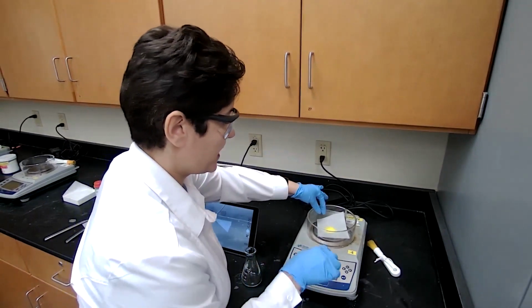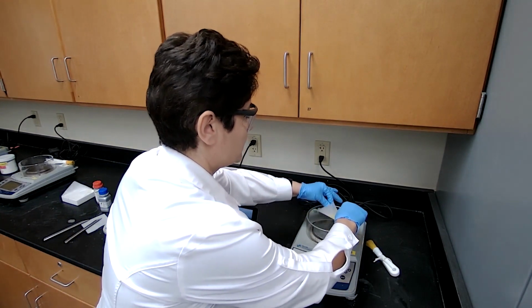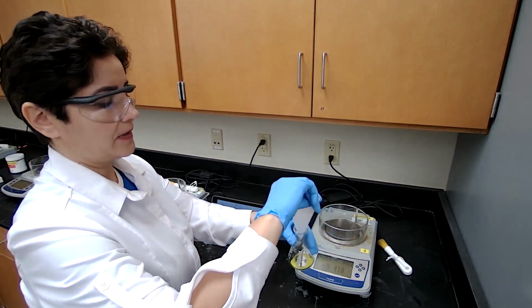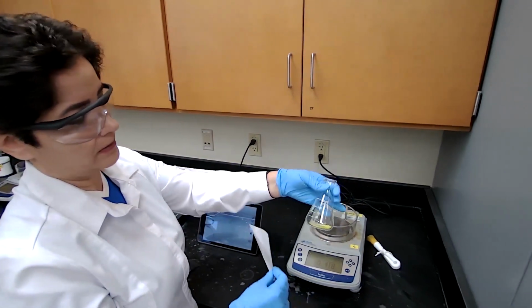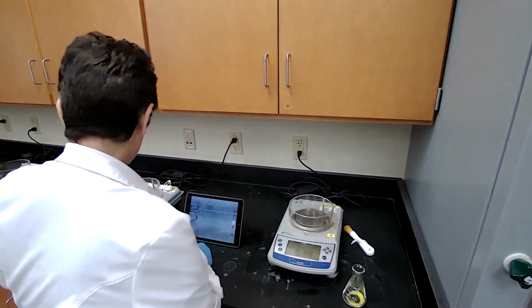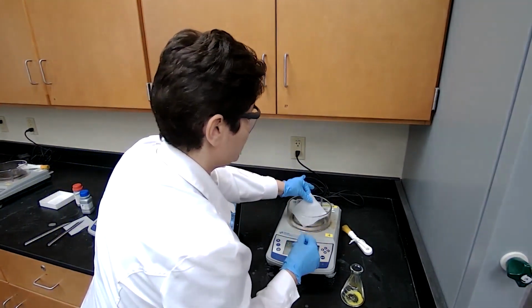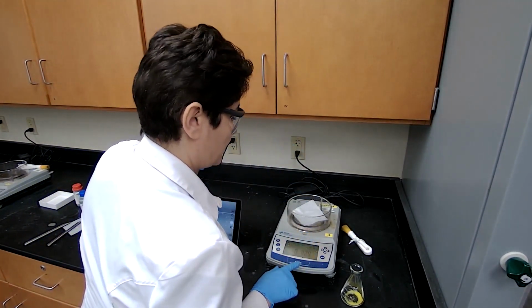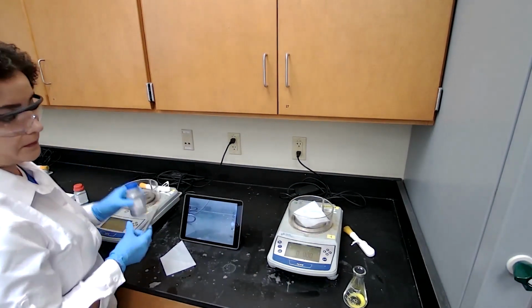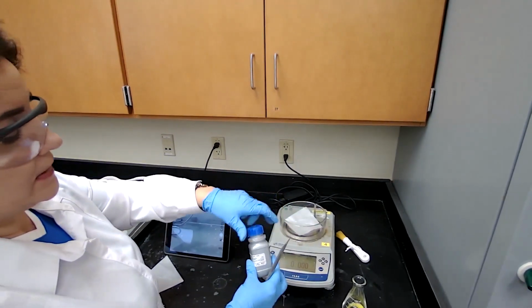Okay. So we have the mass of the fluorenone. We transfer that into an Erlenmeyer flask. The size of the flask shouldn't matter much, but I'm using the 125 for the volume of the solvent that is given. It's good. And we are going to measure 0.2 grams of the sodium borohydride as a reducing agent.